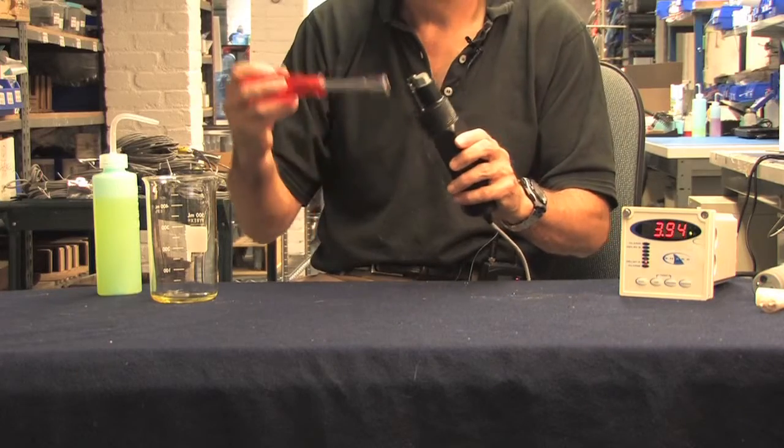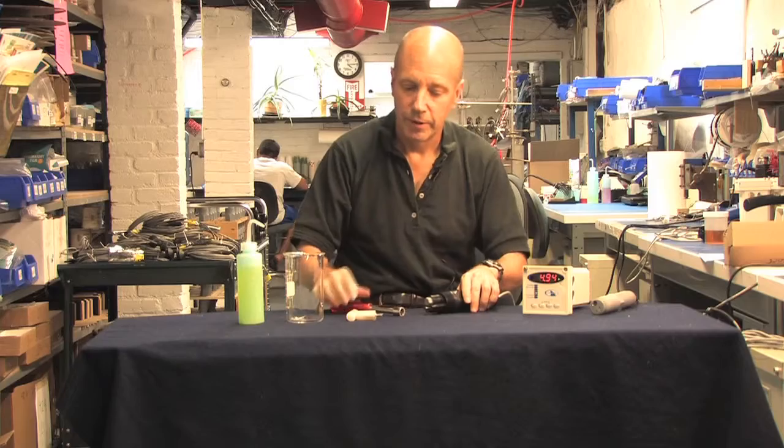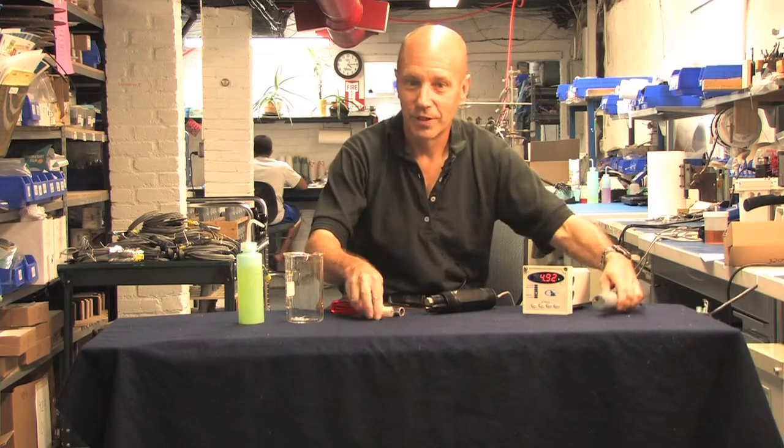Let's talk about the reference solution first. Now, there are two telltale signs that let you know you need to change the reference solution. Both arise from the calibration, which I assume you're doing at least once a month. One, the efficiency of the probe falls below 90%, or two, the pH of the probe after calibration is very different from the pH before calibration. To change the reference solution, simply unscrew the salt bridge. For the 8 series probes, we use a hex driver. For the other probes, a spanner wrench, tweezers, or the force.